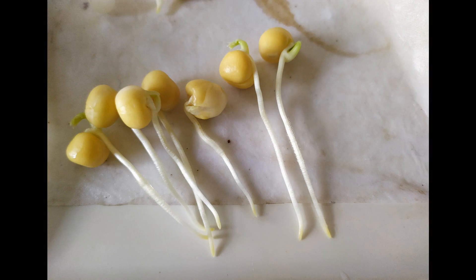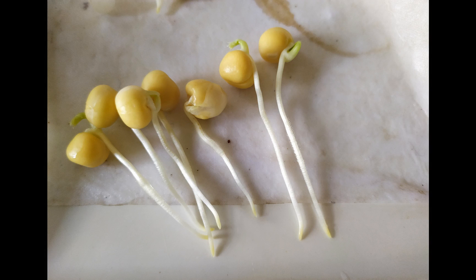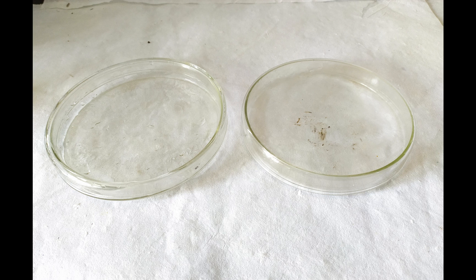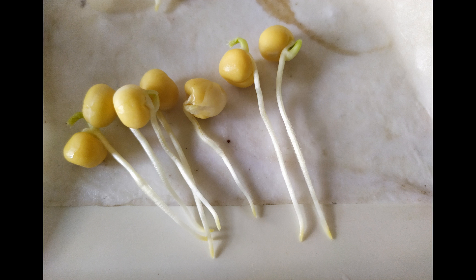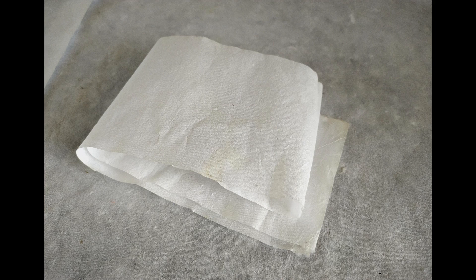In this experiment, we'll be investigating the effect of gravity on the growing roots of germinating seeds. For this experiment, we'll need the following: a large petri dish, germinating seeds with straight roots, and filter papers.